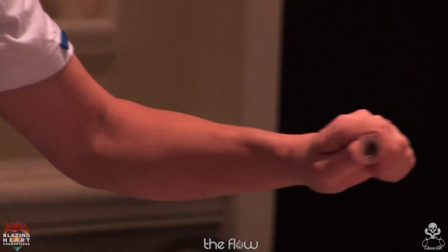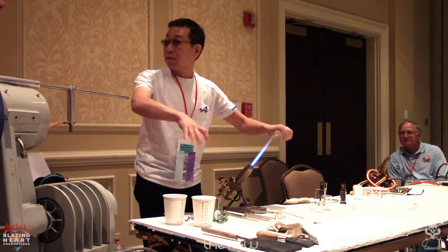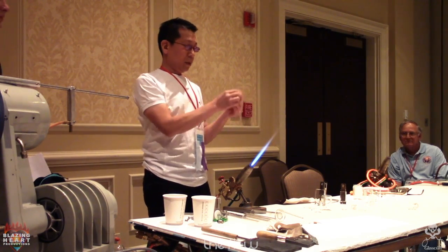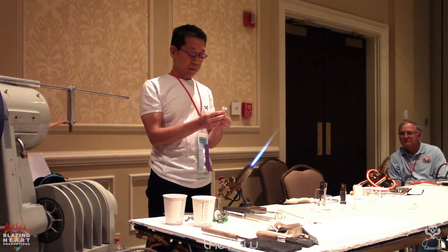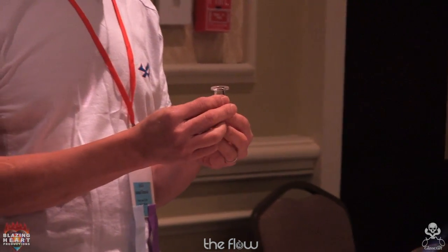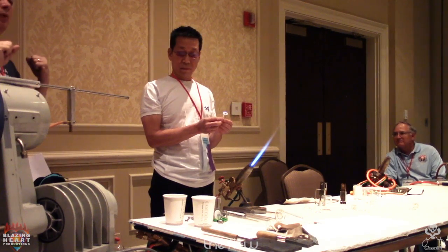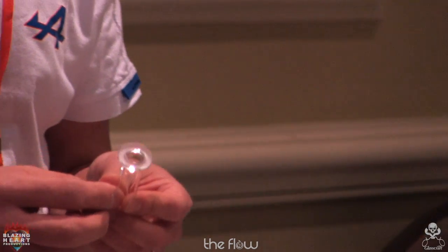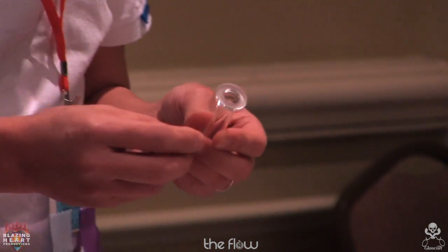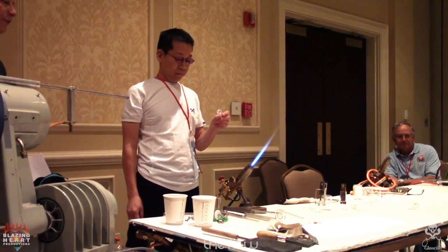It's tooled, with a mold and roller, and he makes those and then sends them out to get them ground. That was an interesting thing that Tracy and I found. There are specialized folks that do grinding. So the toolers will most often not do their own grinding. They'll tool up their joints and send a big box of them over to the grinder, and the grinder will bring them back, and then they're finished and flat.